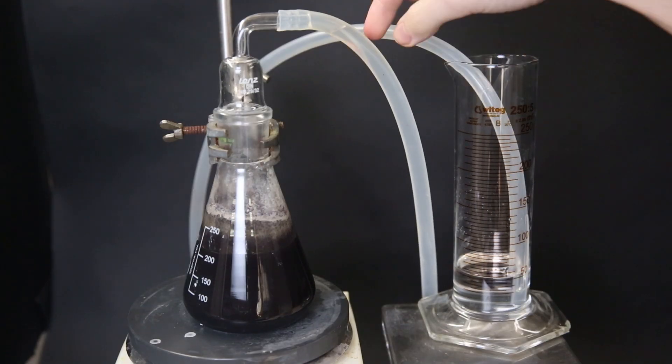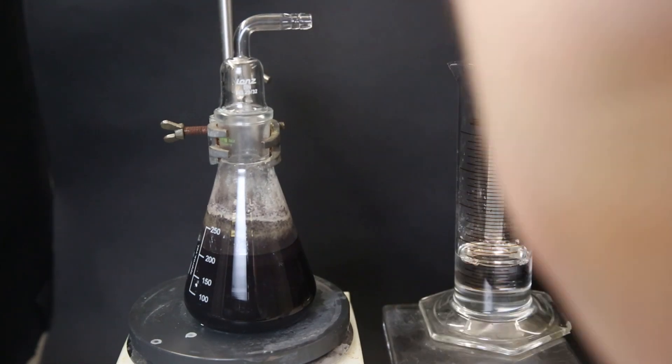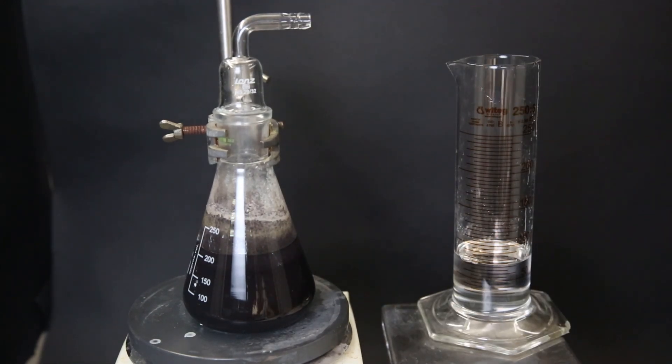So I come back the next day and it's less than 15 hours later and it looks like the oil in the trap has back flowed which indicates that the reaction is done. So I take it apart and let the flask cool to room temperature.